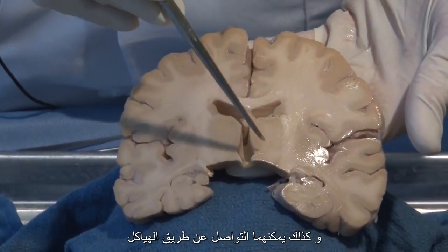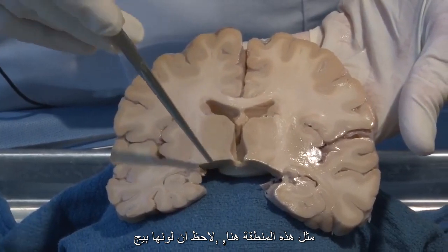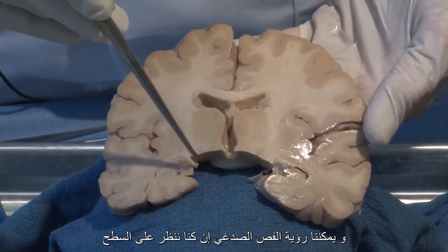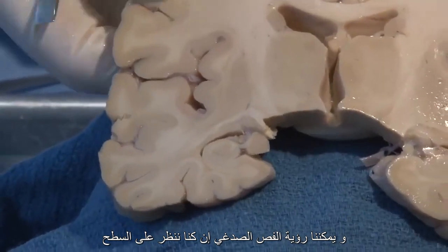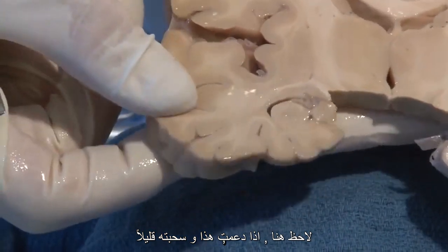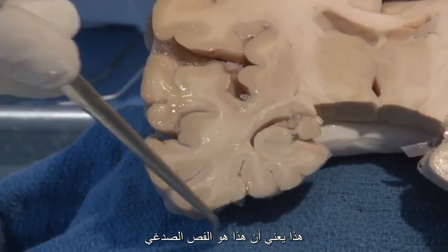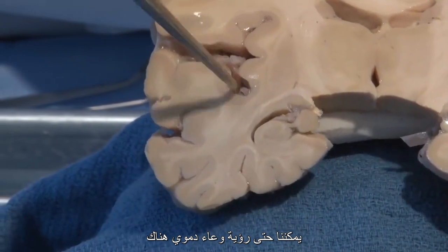In addition, they can communicate through structures like this deep area. You notice it's beige, so it's mainly cell bodies. A deep structure called the thalamus. And here we can see the temporal lobe that we were looking at on the surface. Notice here, if I prop this up and pull it down a little bit, you can see that large lateral fissure that we saw on the lateral surface. That means that this is the temporal lobe. You can even see a blood vessel in there.